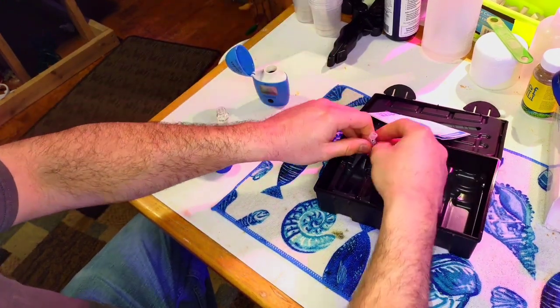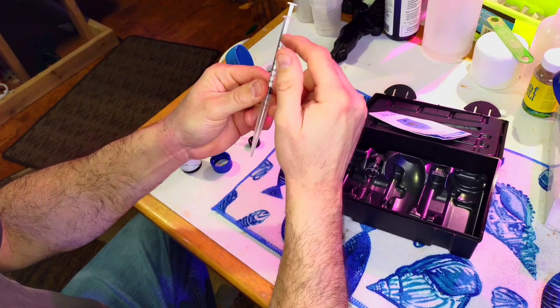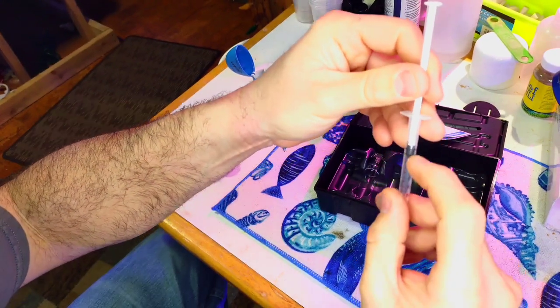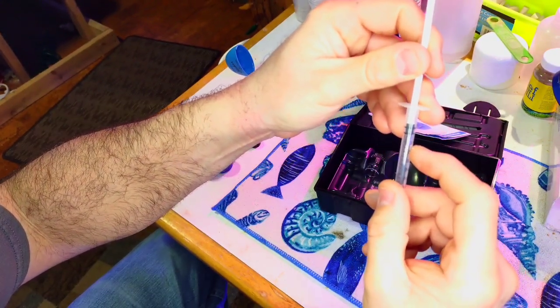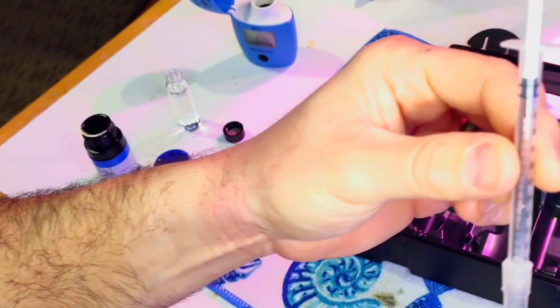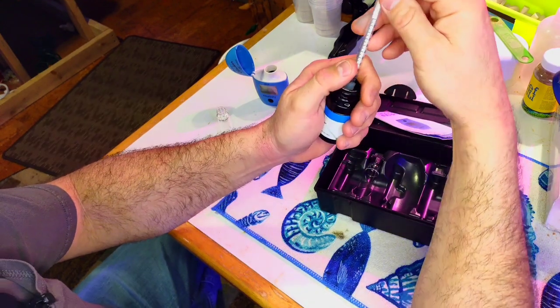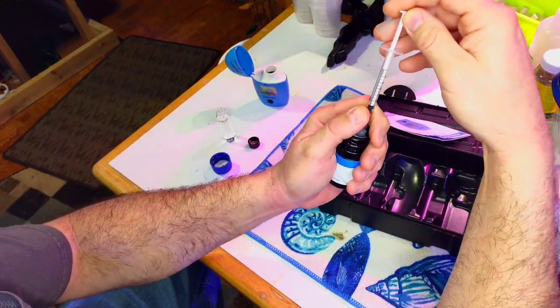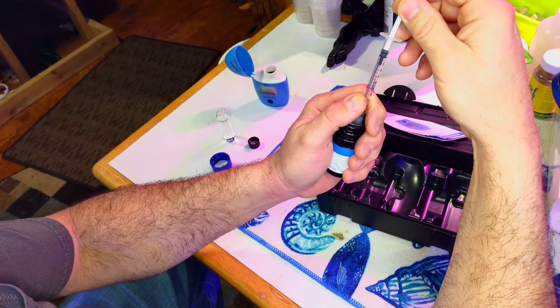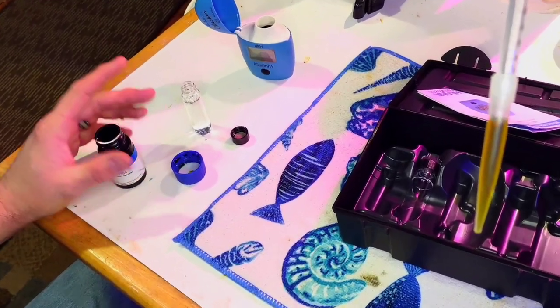Make sure you use the adapter every time with this test kit — it's important. Put it on, and you'll see two different lines on the syringe. You want the bottom line lined up with the very first line at zero — that's how far up you draw it. As you put in the reagent it'll be easier to see. Stop it right about there — that's where the reagent goes.